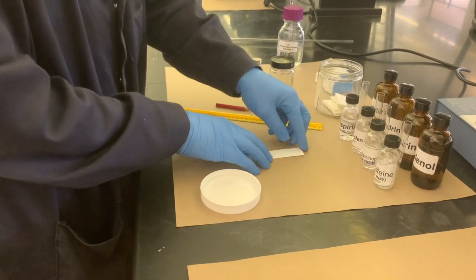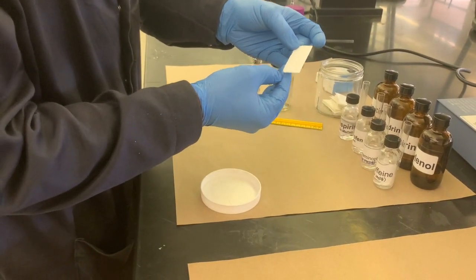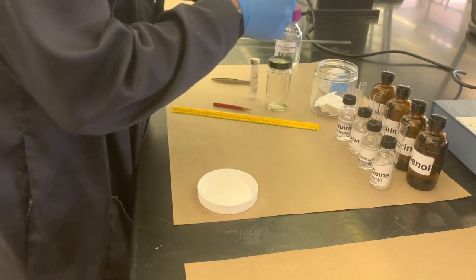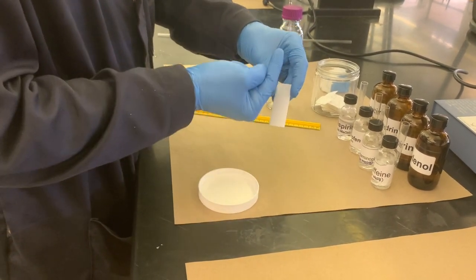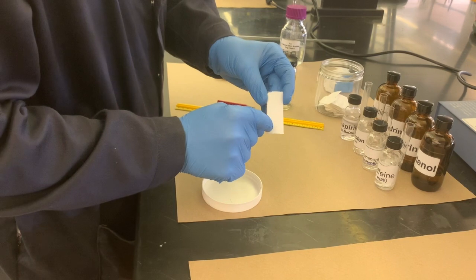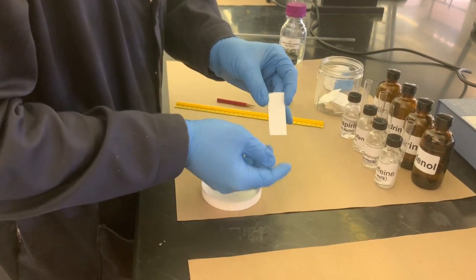You also want to try to pick a TLC plate that has as even a coating of silica as possible, at least on one side. This one has some of the silica chipped off the corner. That way the eluent will flow evenly and diffuse straight up instead of diagonally. If it flows diagonally, you could have your sample pushed across the plate into the line of the other sample.